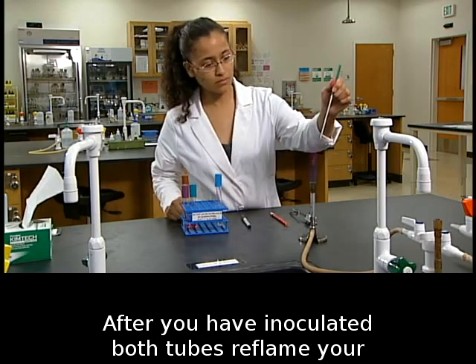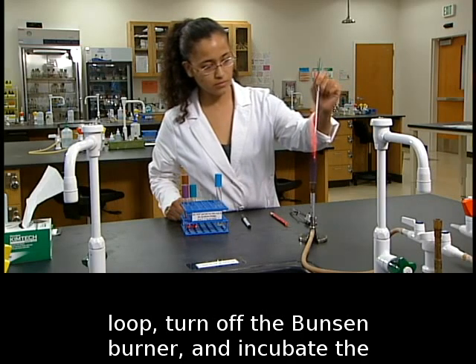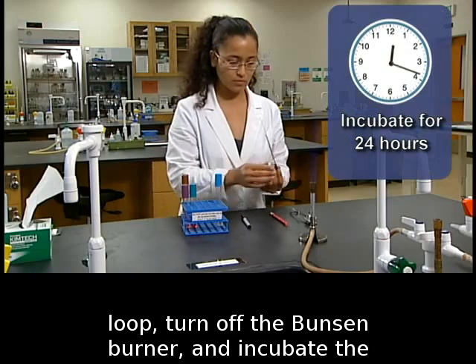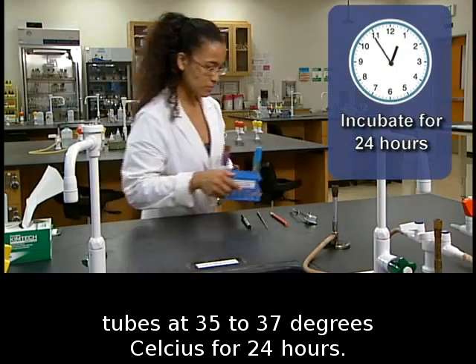After you have inoculated both tubes, reflame your loop. Turn off the Bunsen burner and incubate the tubes at 35 to 37 degrees Celsius for 24 hours.